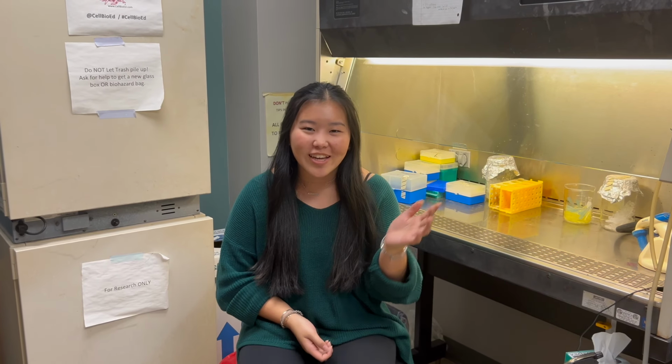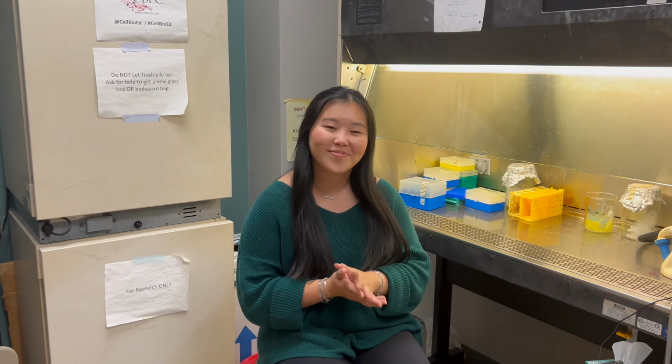Hey guys, I'm Jenna and we're going to be doing a video on AOPI staining. If you haven't already watched the cell splitting or the cell counting video also on this YouTube page, I recommend you go ahead and watch that before you watch this video, okay?